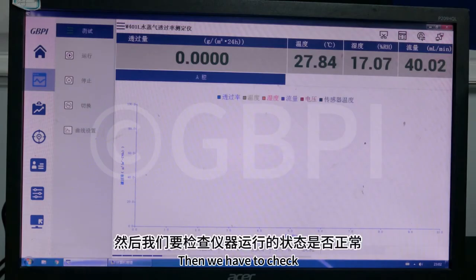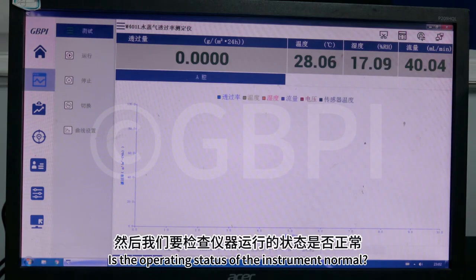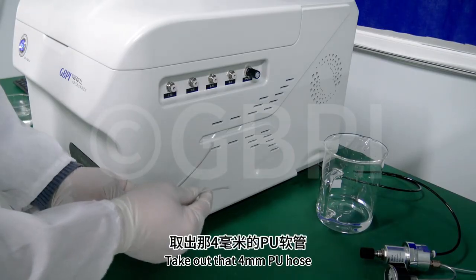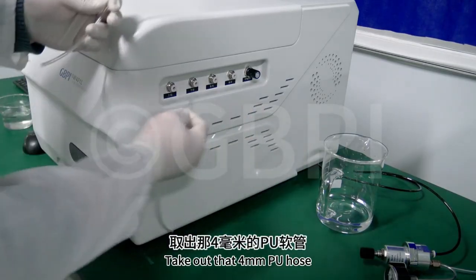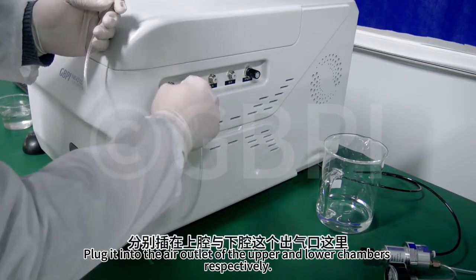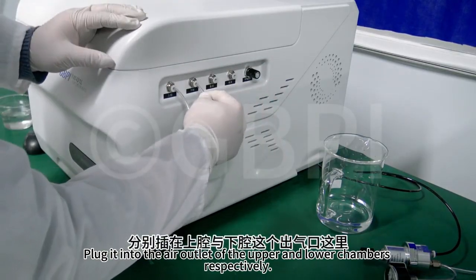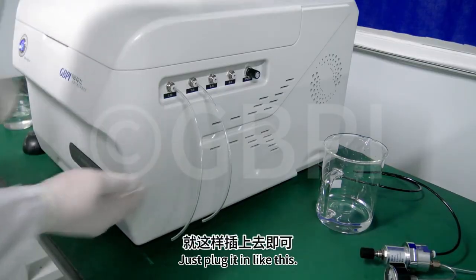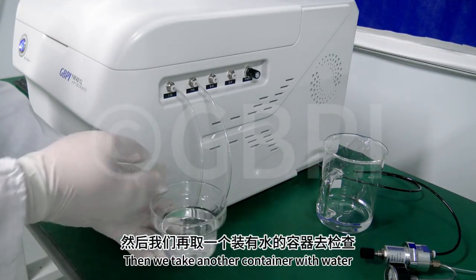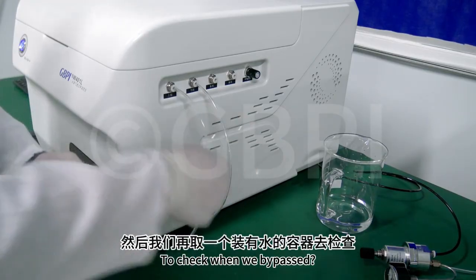Then we have to check, is the operating status of the instrument normal? We get it from the accessory box. Take out that 4mm PU hose. Plug it into the air outlet of the upper and lower chambers respectively. Just plug it in like this. Then we take another container with water to check when we bypass.